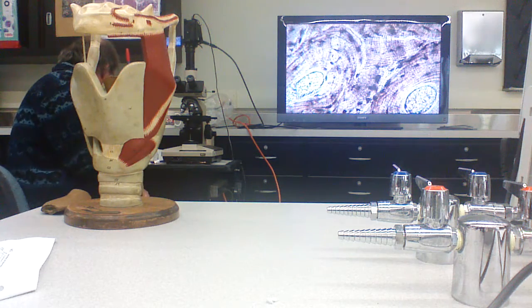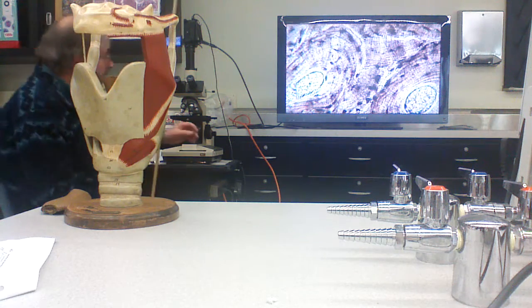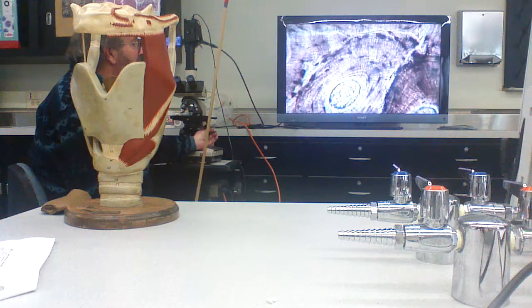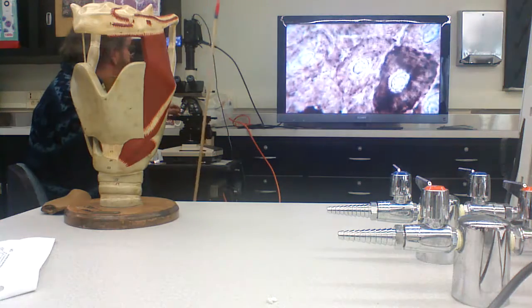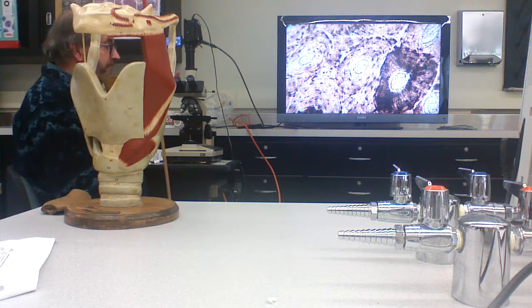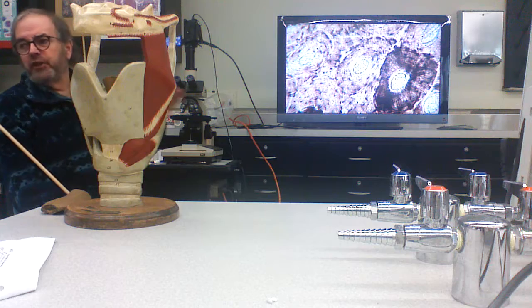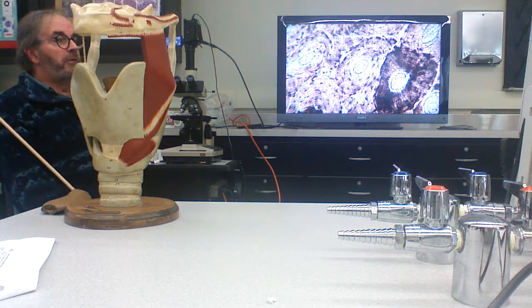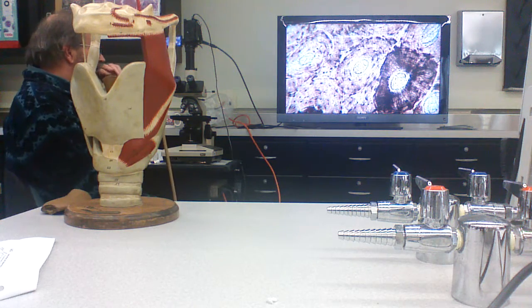Now let's talk about compact bone. Compact bone has a cylindrical structure and substructure. If you look at a piece of bone, the way this was taken is a small slice of bone, and you polish it using a graded series of grinding media, grits and that sort of thing.